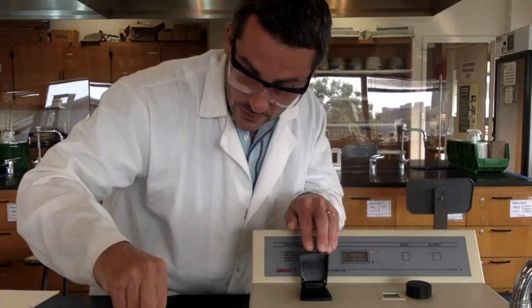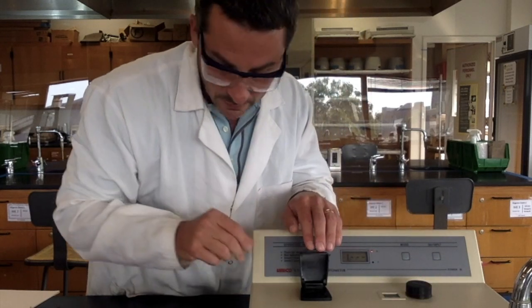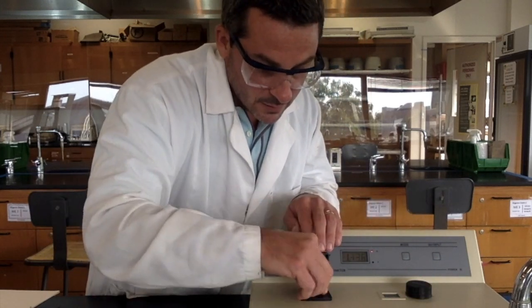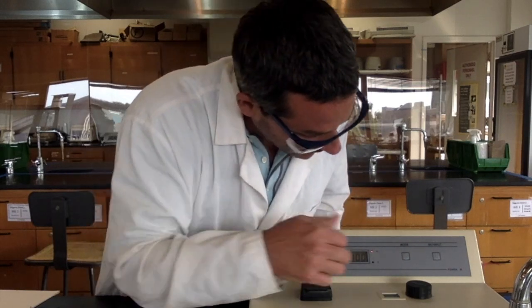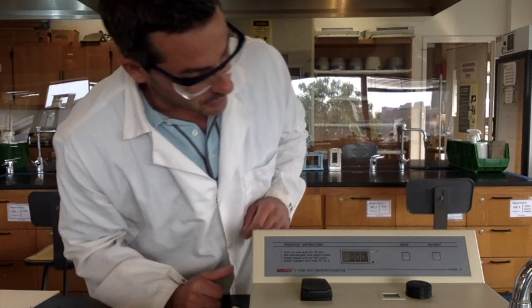It should also be known that sometimes the absorbance will go up and down a little bit. The sample might absorb light differently at different wavelengths. So it could have a little peak lower down on the lower level of the wavelengths, and then again at a bigger one. You just want the highest peak. You want to find the wavelength that gives you the highest absorbance.